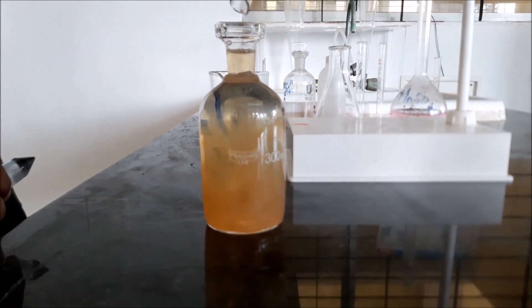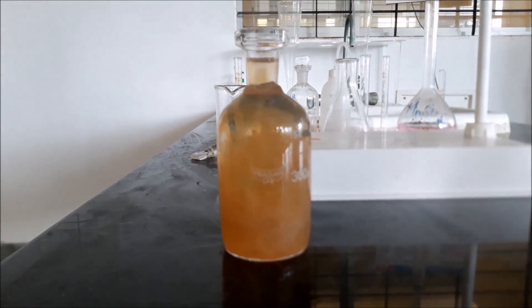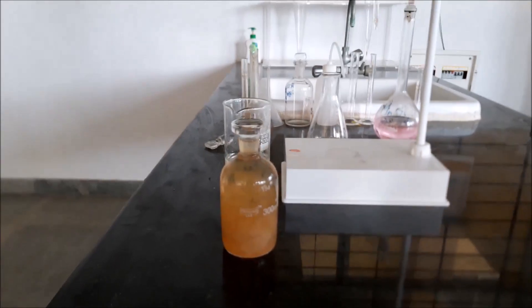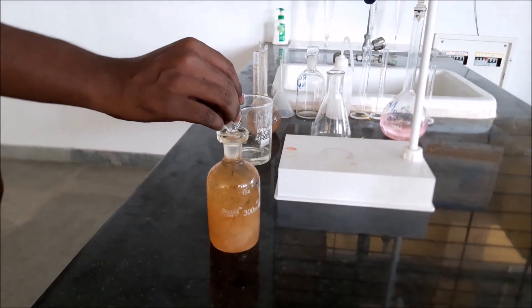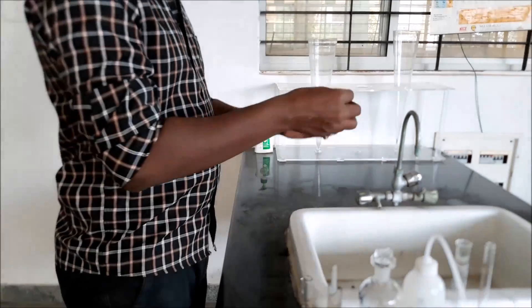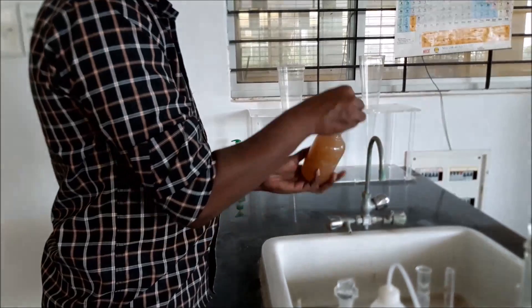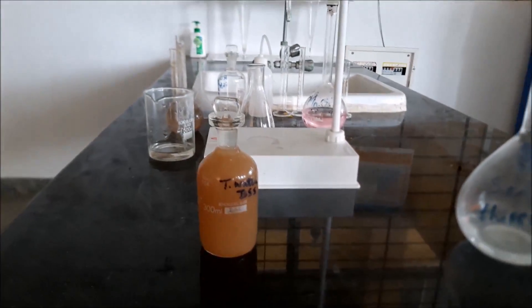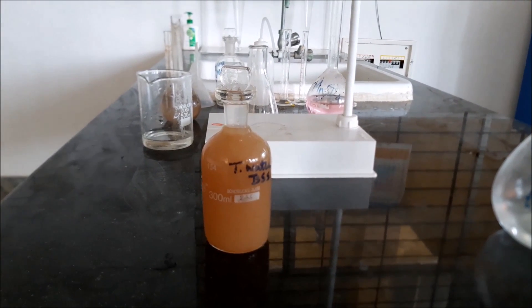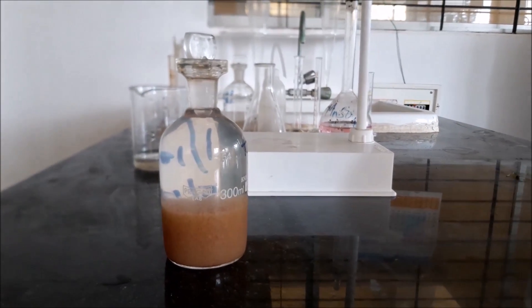As you can see, there are air bubbles in the sample — tiny air bubbles are created. Before titrating, mix it well until the air bubbles have vanished, then allow it to precipitate. It is being mixed well in order to eliminate the air bubbles trapped inside. Once all the air bubbles are eliminated, allow it to precipitate before the titration. After a while, you can see that it has precipitated completely.